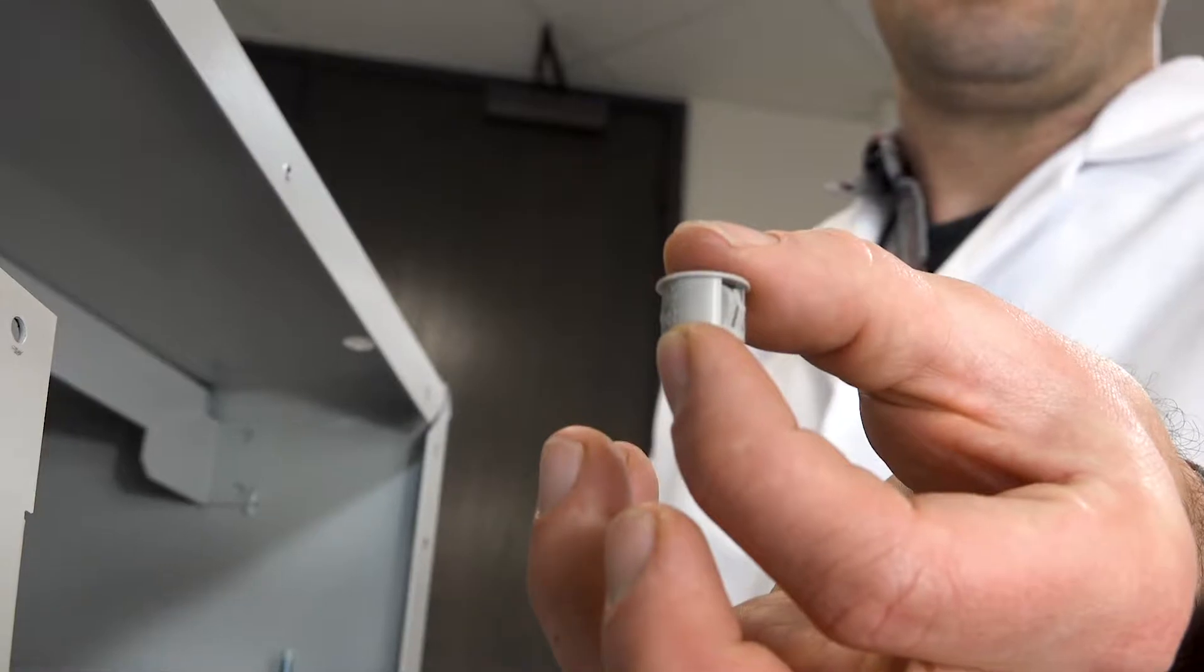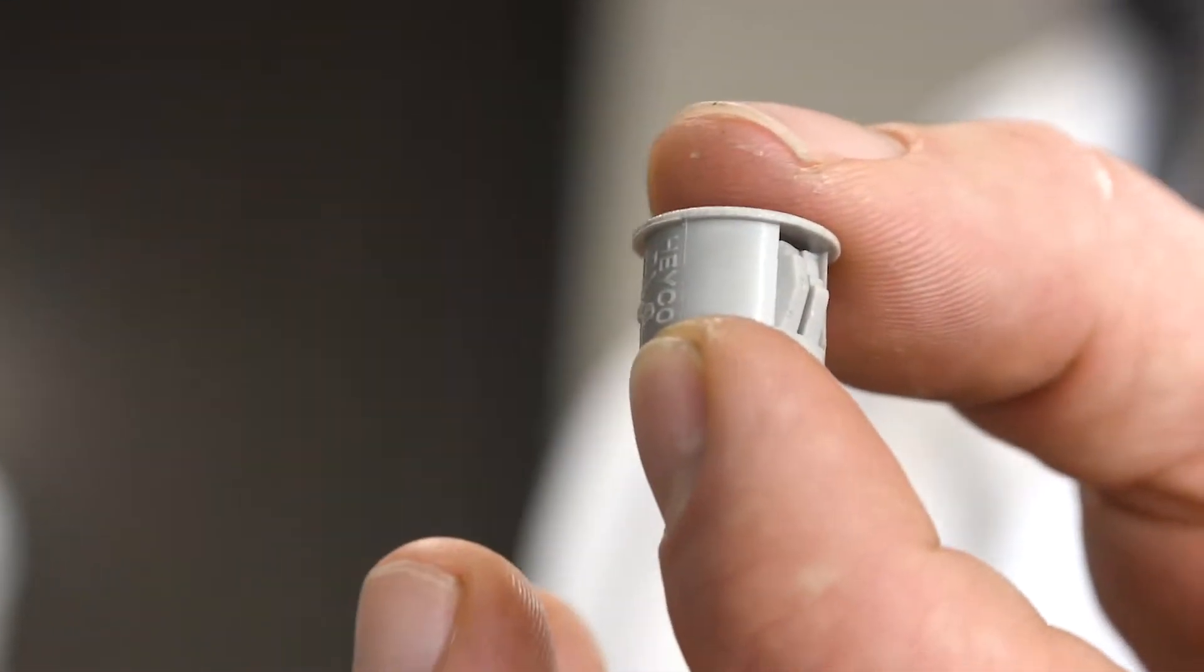Remove the four plastic hole plugs from the top of the freeze dryer on which the stopper and tray dryer is to be mounted.